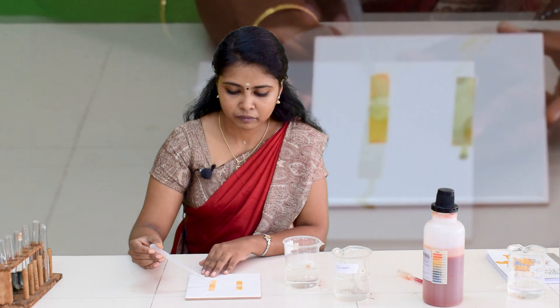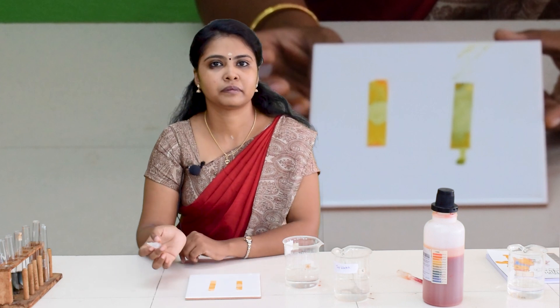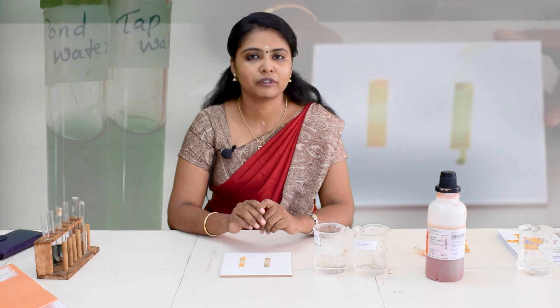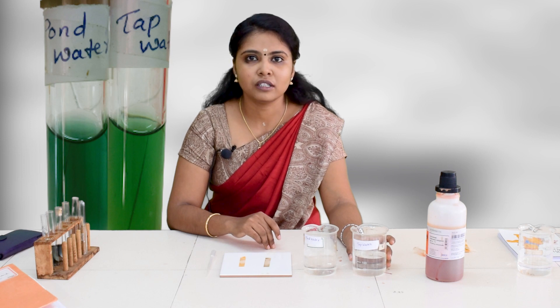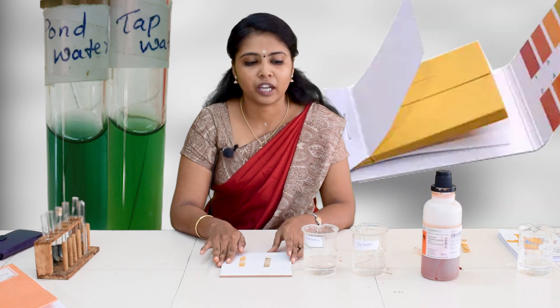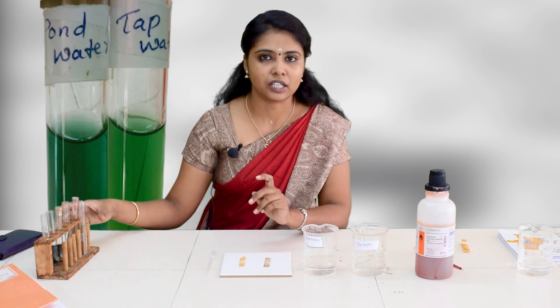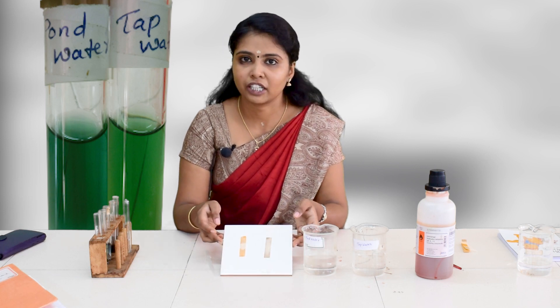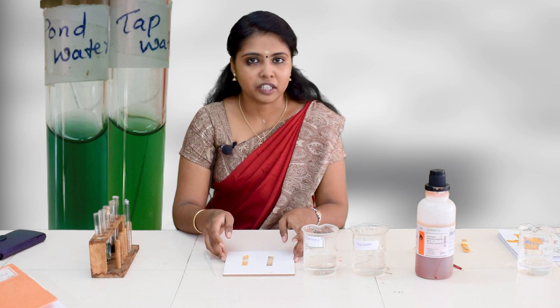Take another sample of tap water and do the same thing on another pH paper — it also shows green colour. Today we conducted the experiment to identify the pH of different water samples using pond water and tap water. We used two methods: one using a universal pH indicator with a test tube, and the other by dropping water onto pH paper using a dropper. Hope you all understood — thank you.